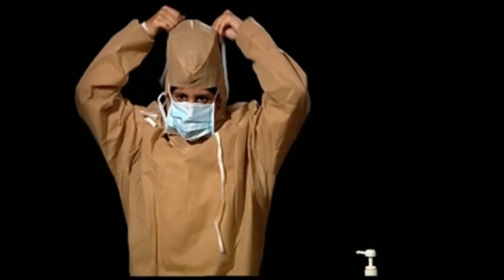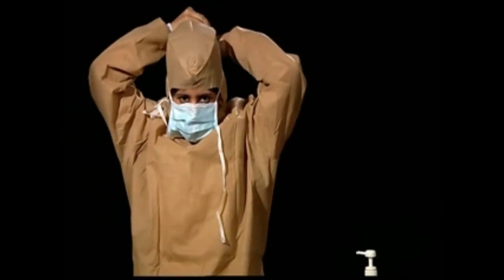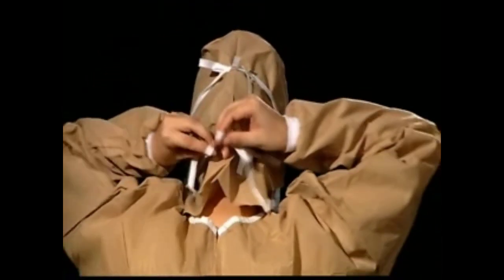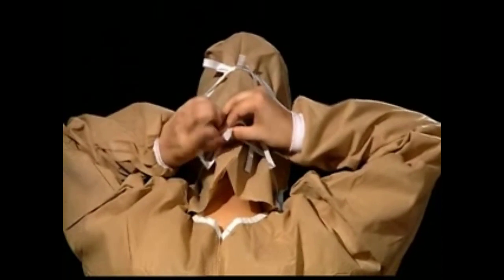Using both hands, hold the upper strings and take them behind your head. After appropriately placing the mask on the mouth and nose, tie the strings behind your head. Now repeat the same action with the lower strings.